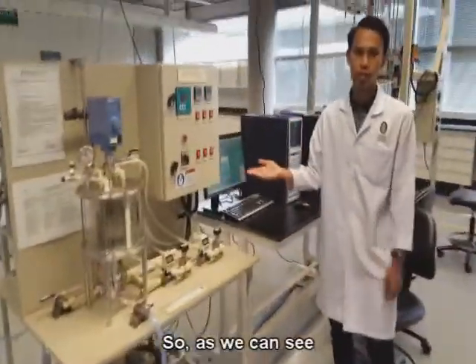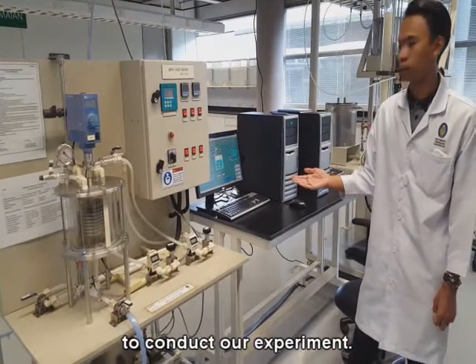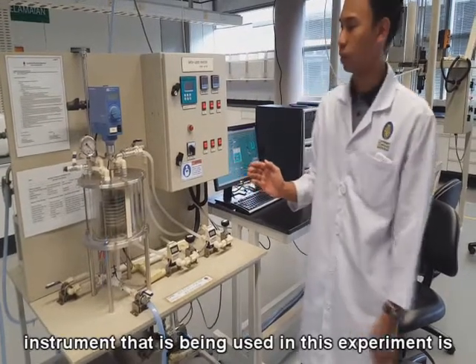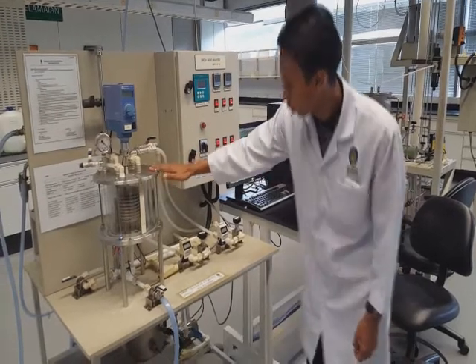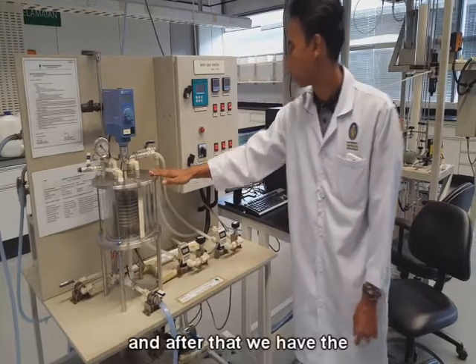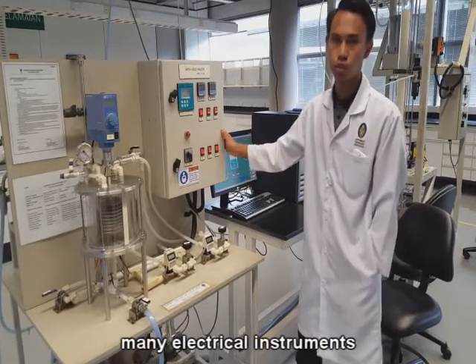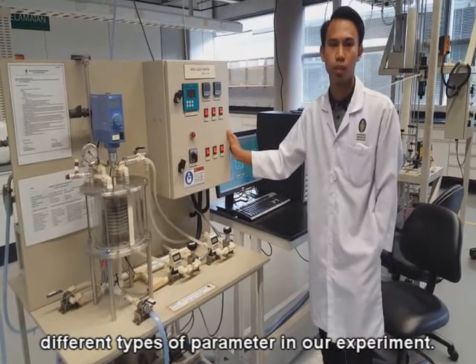So, as we can see, here is the apparatus that is being set up to conduct our experiment. The first and foremost important instrument used in this experiment is the reactor itself. As we can see, this reactor is a batch type reactor. After that, we have the control panel, which consists of many electrical instruments that are used to measure different types of parameters in our experiment.